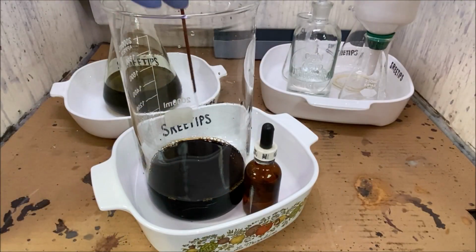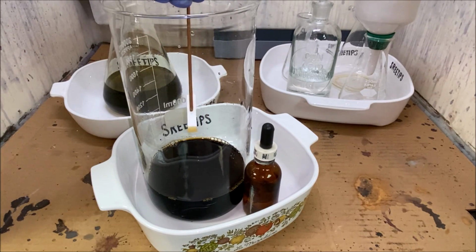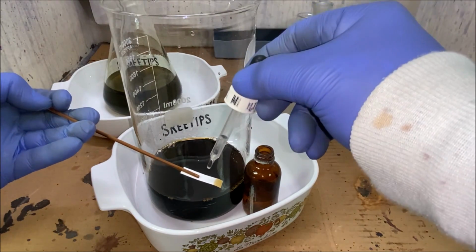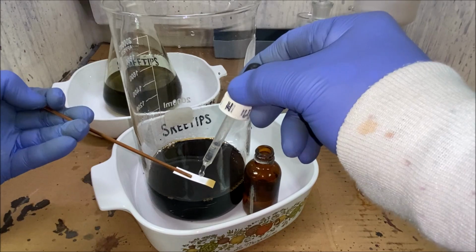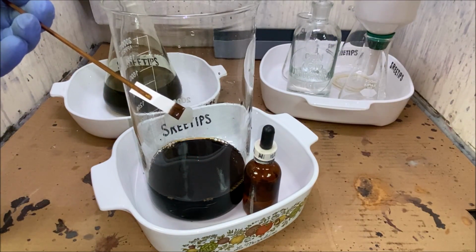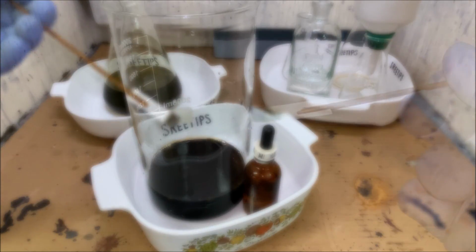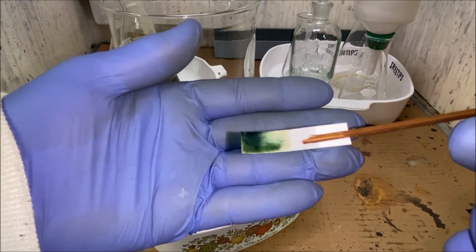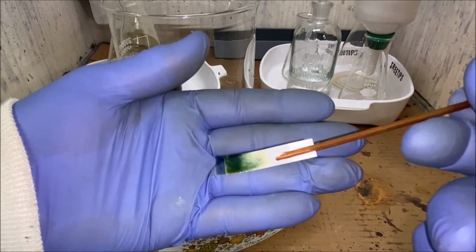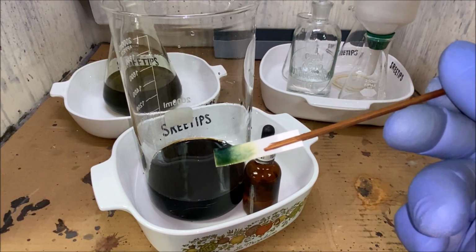Let's do a stannous test. Get a little bit of this solution on a piece of filter paper and hit it with some stannous chloride. Boom. Got precious metals in solution. You can see the stannous test is turning green, and that indicates that most of this is probably going to be palladium.